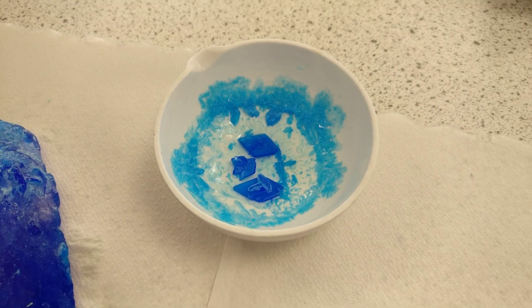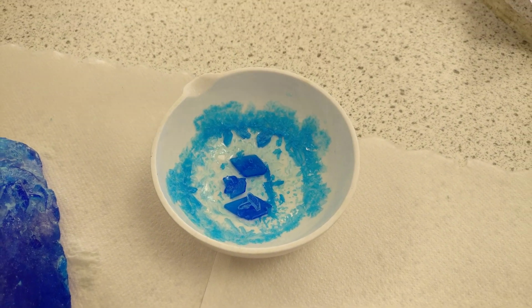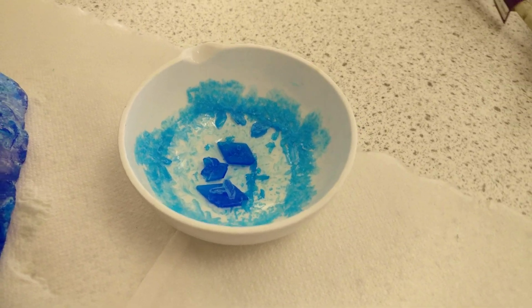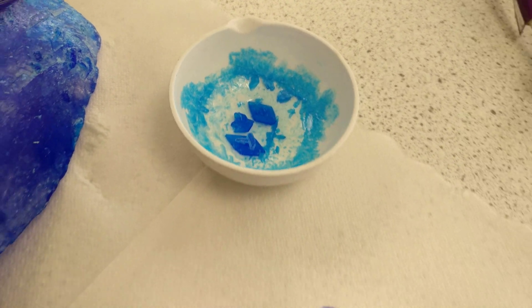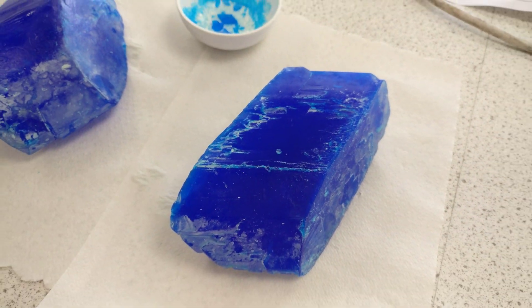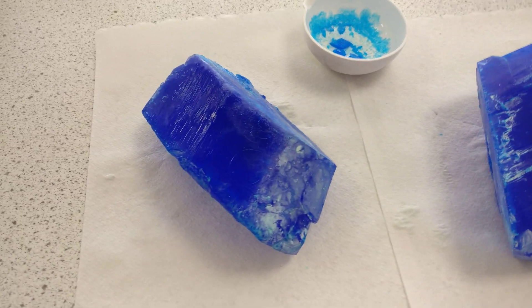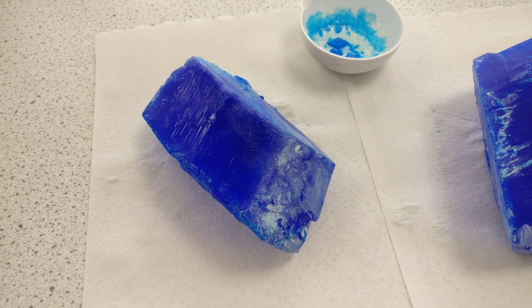Some students have made these — they've evaporated off the rest of the solution of copper sulfate. These have been pre-made over a long period of time, but they are massive.